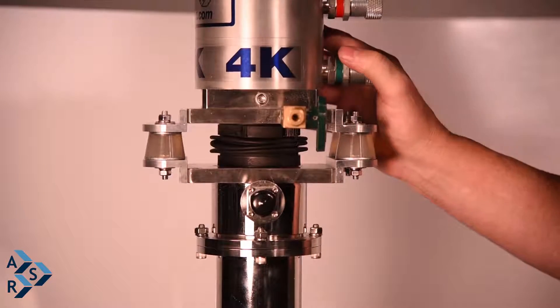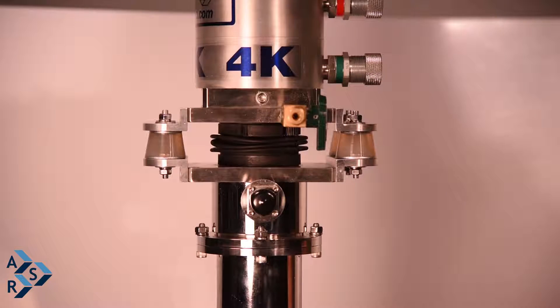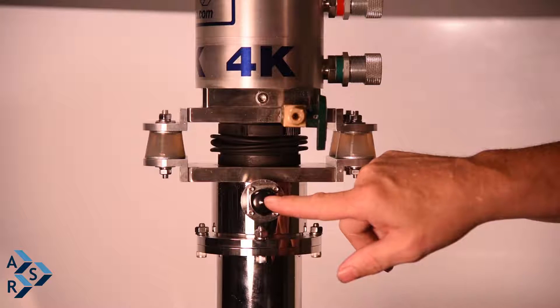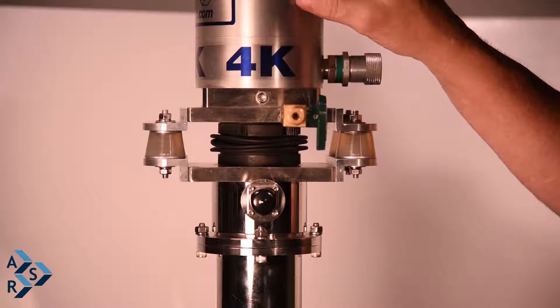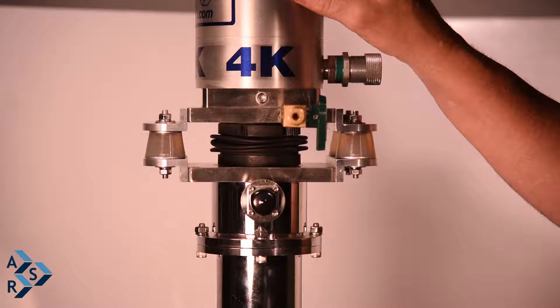I'm here today to talk about the DMX20OM and we're going to show you a couple different ways to set this on an air table and to get the best vibration set up for your system. This is one configuration of the system — we have our cryostat, your interface, and your instrumentation port. What we have here are little vibration dampeners that we installed, and depending on what your application is will determine how critical vibration isolation needs to be.